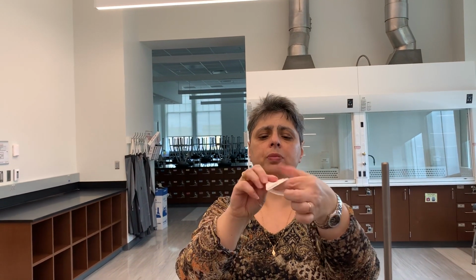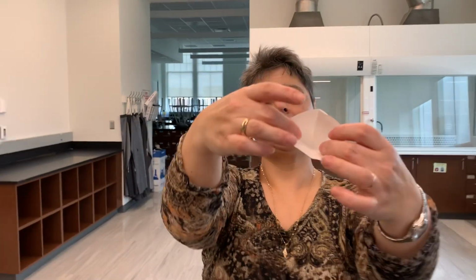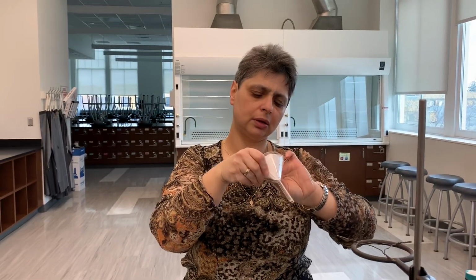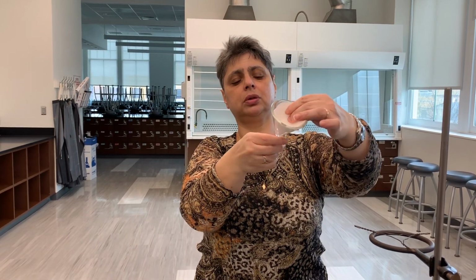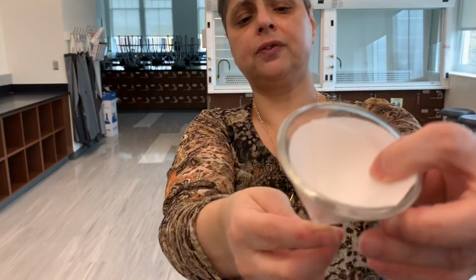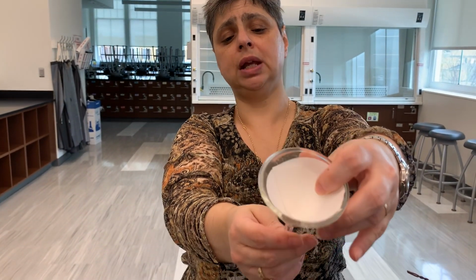And then I'm going to open the paper where the larger quarter was, so you can hopefully see it creates a cone. And this cone will fit nicely into my funnel. As you can see, when I place the filter paper in the funnel, the paper covers the funnel completely. You almost cannot see any glass. That's how it should look.